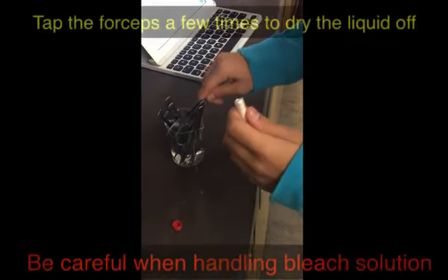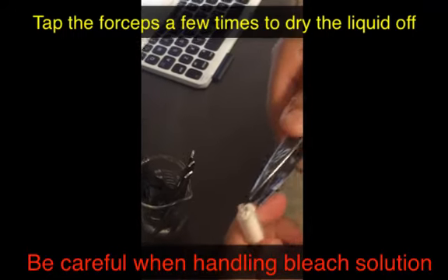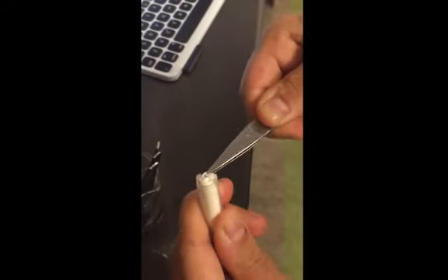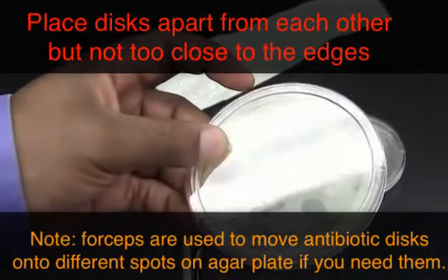To get the antibiotic disc from one of the vials, you just open it from the bottom. Then you get forceps. It's in alcohol bleach water, so be careful. Then you just push the disc to one side and then pull it from the other side. It might be a little bit hard, but you'll get it eventually. You'll have your antibiotic discs spread in different locations onto the agar.